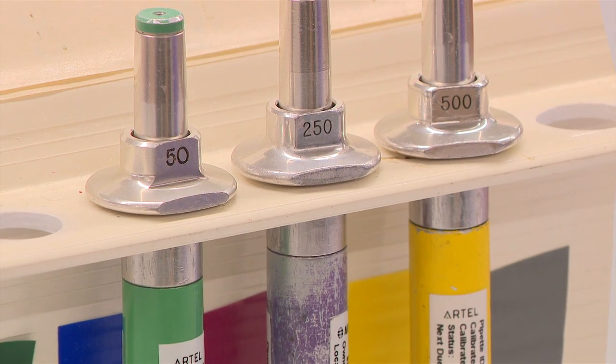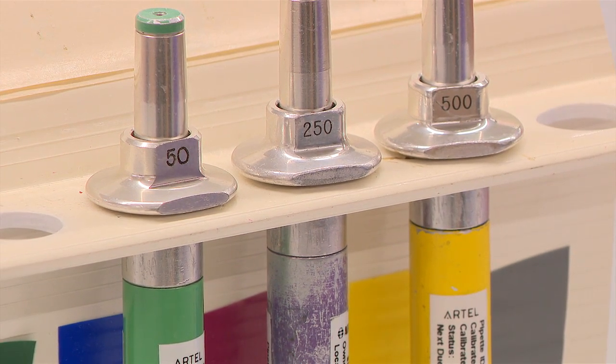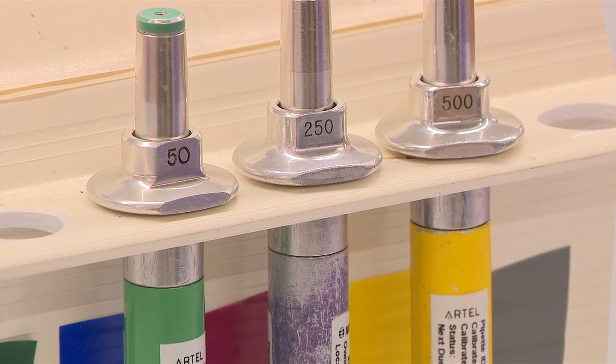The pipettes are color-coded according to volume size and they use standard MLA tips.